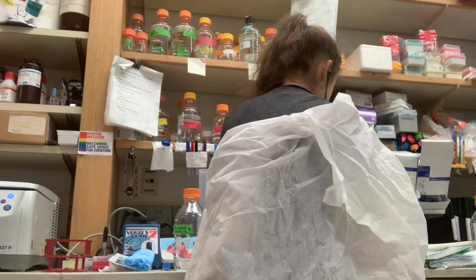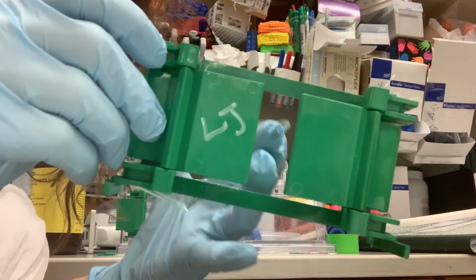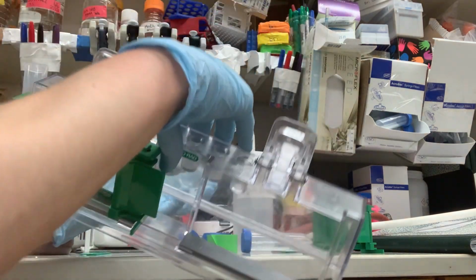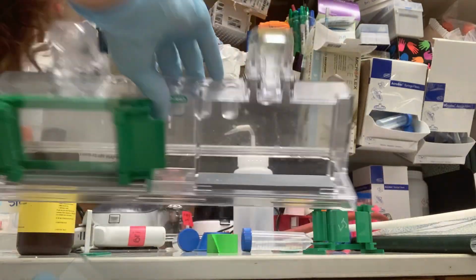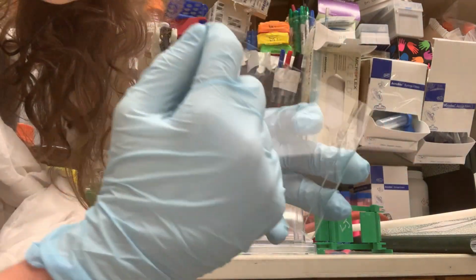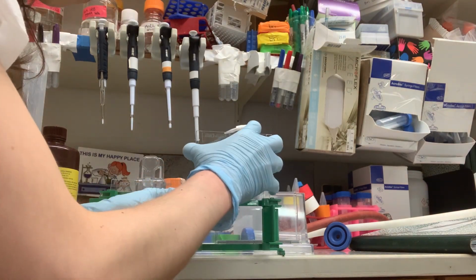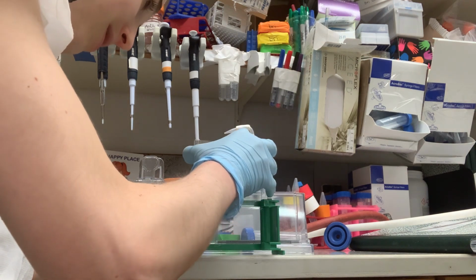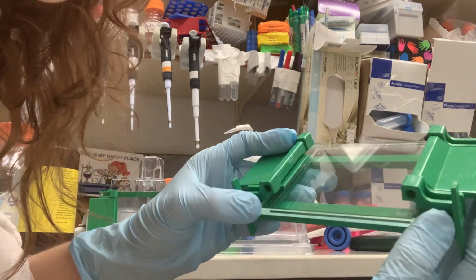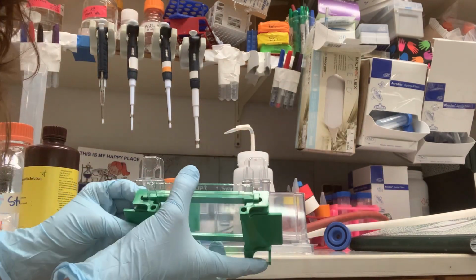But for these gel systems, we have the plates, and then we have these casters. The important thing is you want to prevent leaking, and so we have these, I don't know what you call them, maybe clamps, and then you have these casting tray things, and they have this rubber part on the bottom. So what you want to do is put the short plate in front, and then these have this hole, so you put it down through here. Sorry, it's hard to do this while filming. Okay. And then you clamp it down. What you want to do is go to the bottom and run your thumbs over the bottom and make sure it's even. If these plates are not even, you're probably going to leak. Even if the plates are even, you still might leak.